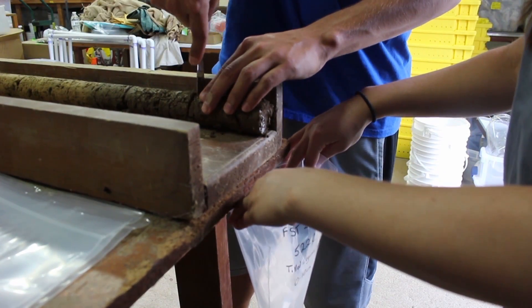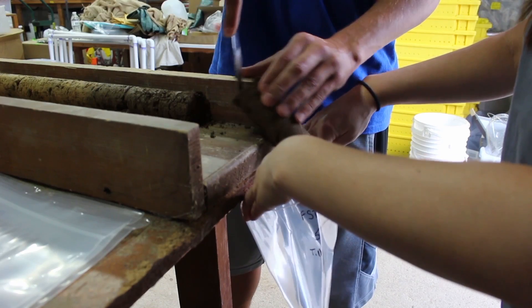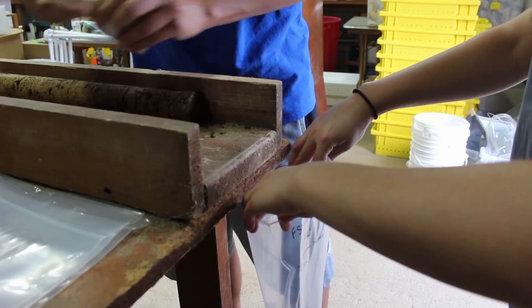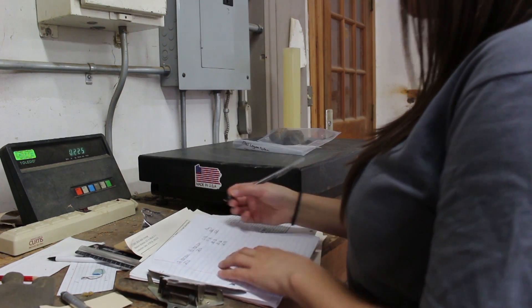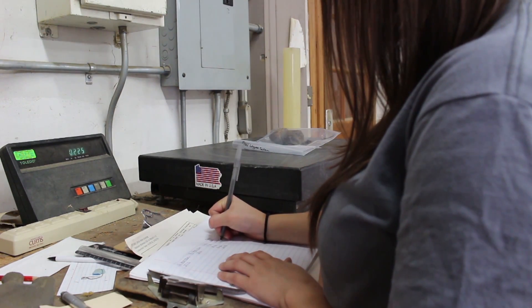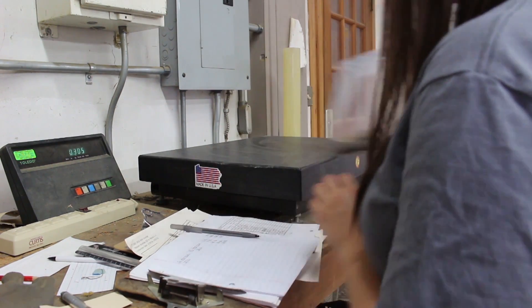After the soil is laid out and dried for five days, the soil will then be sieved and sent off for analysis, which will look at the mineral content of the soil, in addition to the percent carbon and the percent nitrogen of the soil.